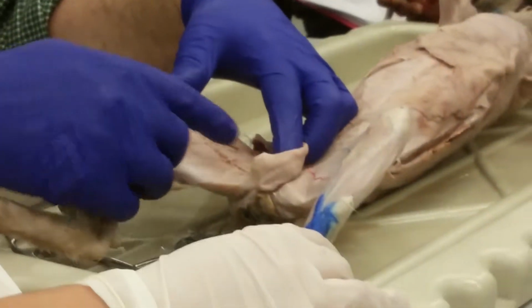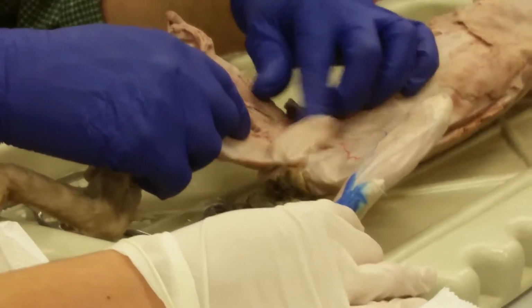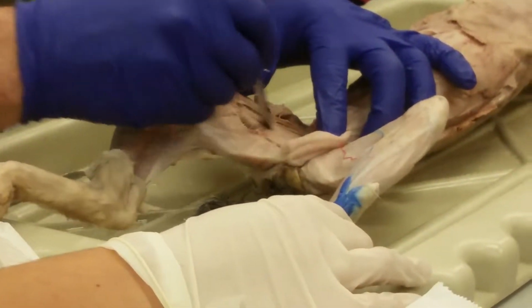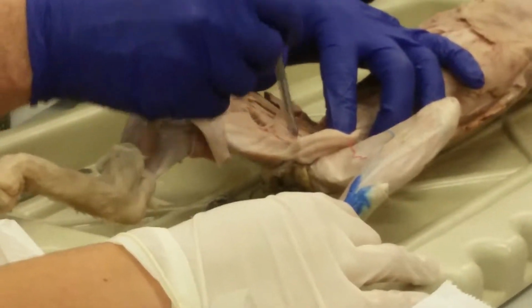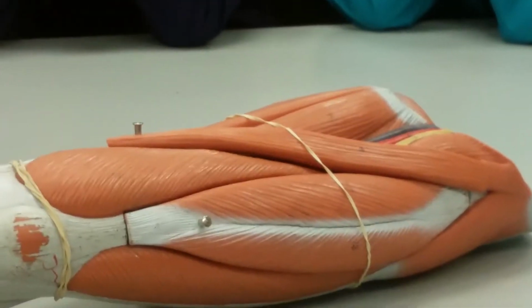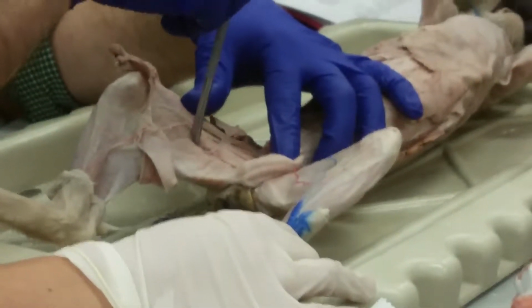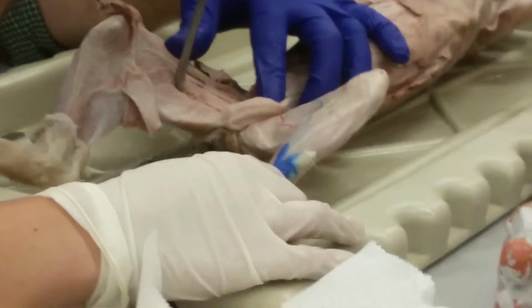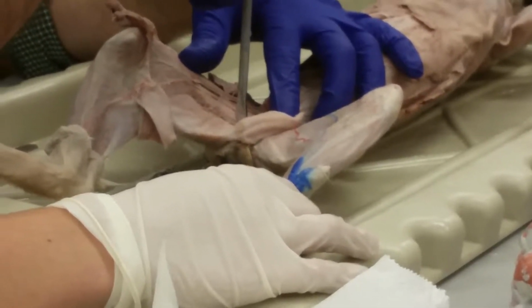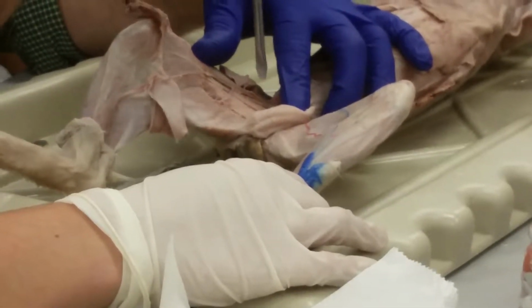So this is actually a posterior muscle right here. This one that we can see. This is a medial muscle. This is the adductor longus, right? Which on the human is right there. Okay? And it goes from the pubic bone down to the femur. So it only crosses the hip, right? And it's pulling from right in the center. And its name tells you what it does. It adducts. Now there's a couple other adductors, adductor brevis and the adductor magnus.